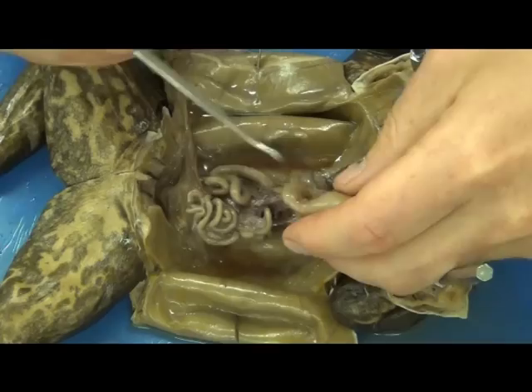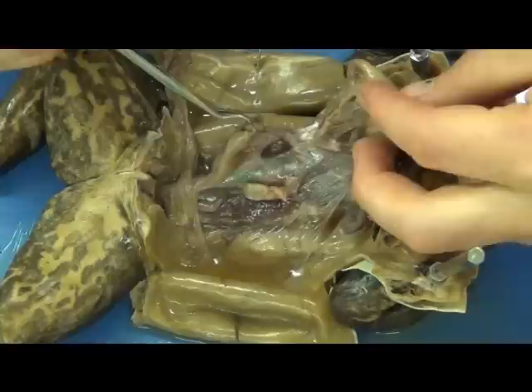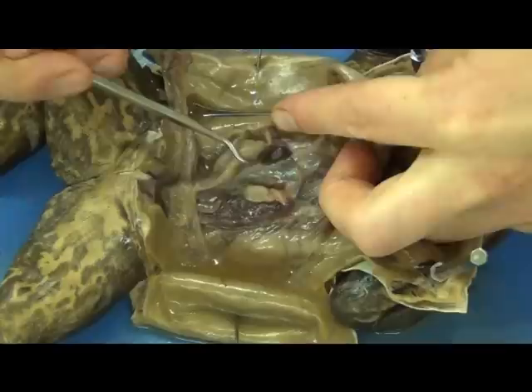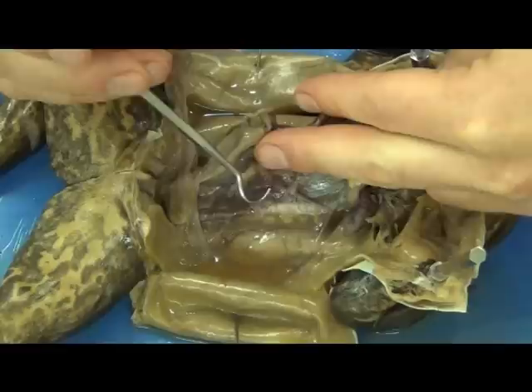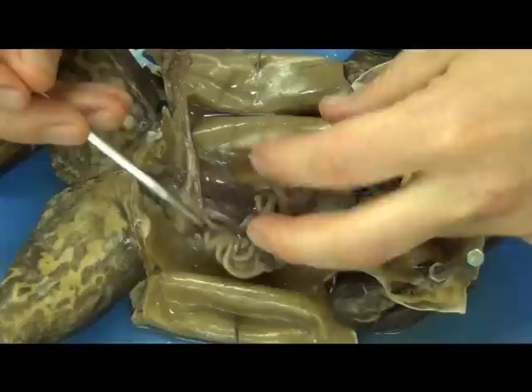You'll have a pancreas on the inside, though this one is poorly preserved. Also nestled within the membranes, you'll see a dark clump or dark organ — that is the spleen, right there. We removed the gallbladder earlier with the liver. Back behind everything, you're going to find two strange organs: dark and flat, nestled one on each side of the spine near what we'd call the back strap. This right here is a kidney, and on the other side, its counterpart, the other kidney.